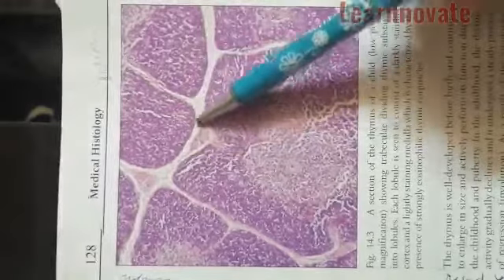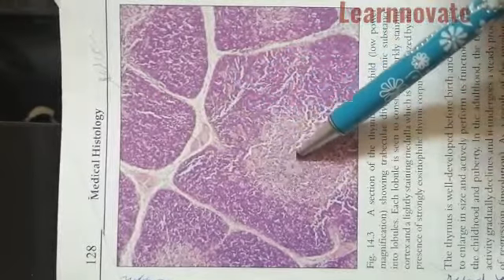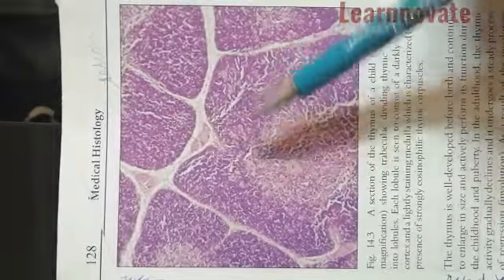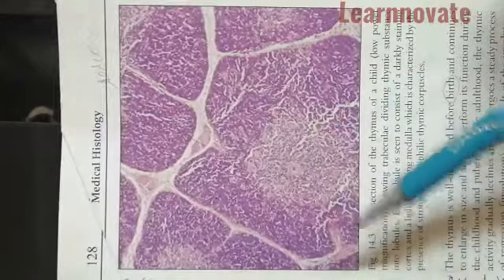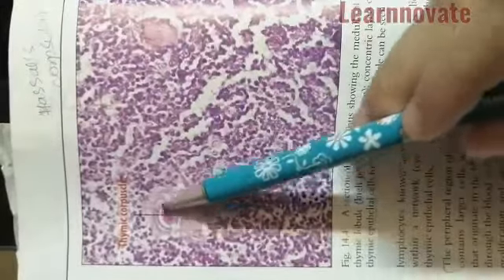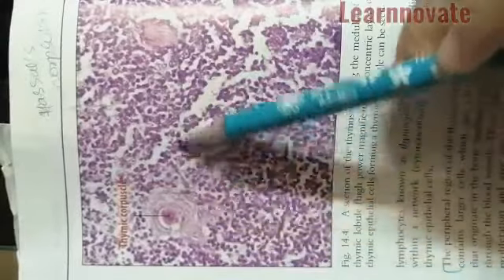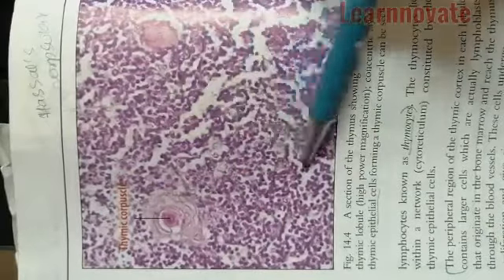Here you can see an artery or vein — a blood vessel present in the section — and in the medulla you can see small corpuscles. These corpuscles are the Hassall's corpuscles. Here in the medulla, a Hassall's corpuscle is shown in greater detail — this thymic corpuscle is a very important feature to identify that the slide is of the thymus. The cells present here are the thymocytes, and the inner medullary cells are the thymic epithelial cells.